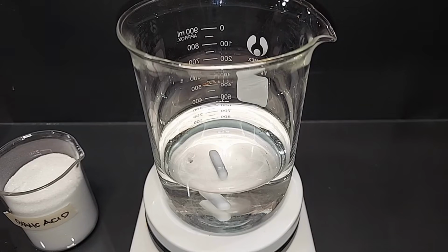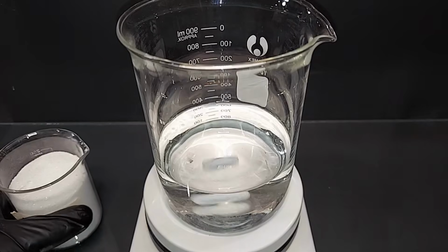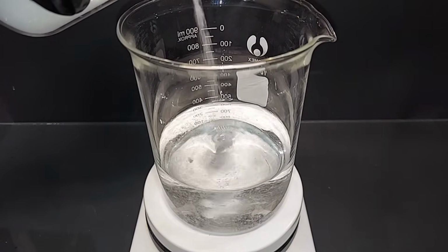Before we put the oxalic acid and the ascorbic acid in the main solution of ferrous sulfate, as I said earlier, I'm going to independently dissolve each of these. So I'm going to dissolve the oxalic acid in 400 milliliters of water first, and then we'll do the ascorbic acid. Turning on the magnetic stir, and I am going to apply some low heat to this. 200 grams of oxalic acid going into 400 milliliters of water.